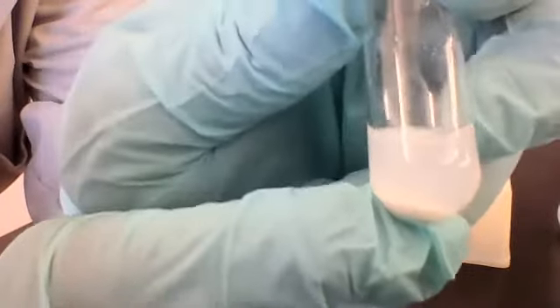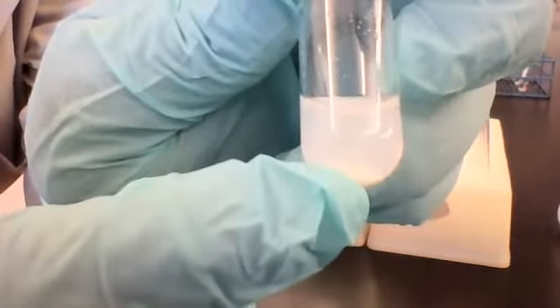And so I believe someone said earlier that it's white. I can see that white color settled at the bottom. So again, for this observation, for the reaction between sodium carbonate, Na2CO3, and silver nitrate, AgNO3, your observation would be that a white precipitate was formed. So you could write white PPT right there.